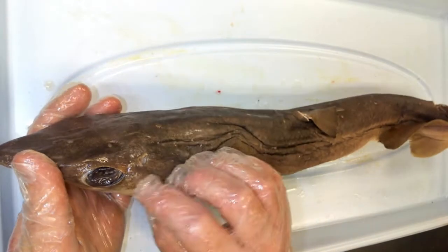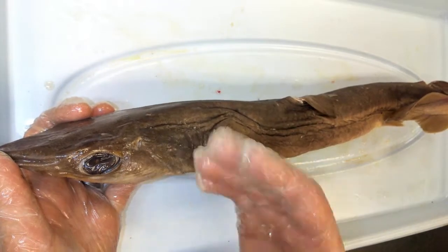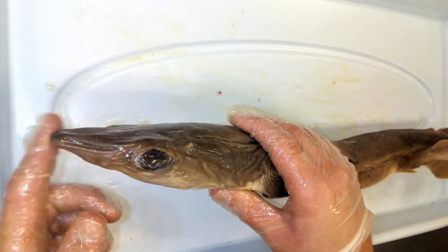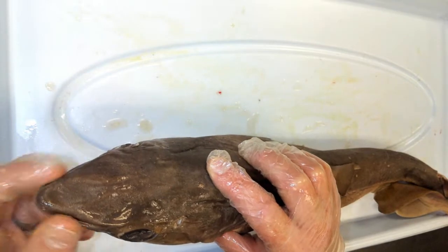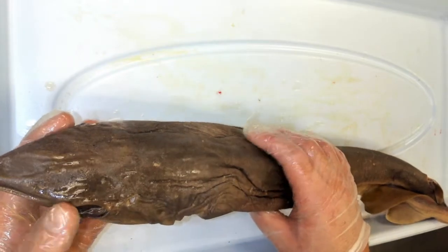We can see the shark's eyes, which have a transparent film that covers them to protect the eyes. It also has a very pointy snout known as a rostrum, which is part of its streamlined, torpedo-shaped body that reduces drag as the shark swims.